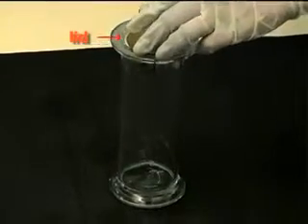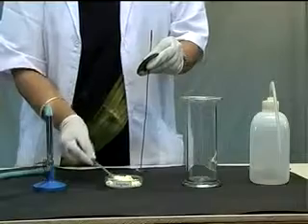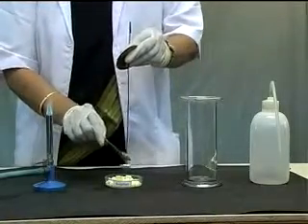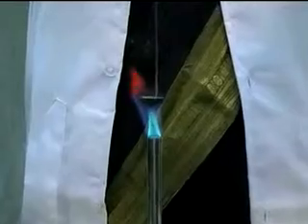The spoon is heated here with elemental sulfur evolving a gas, and then brought inside the jar.